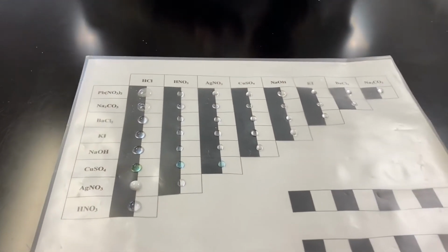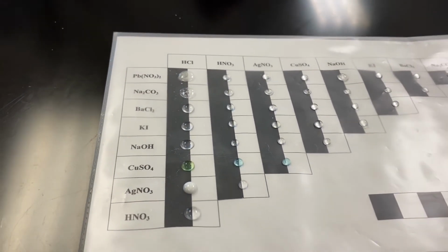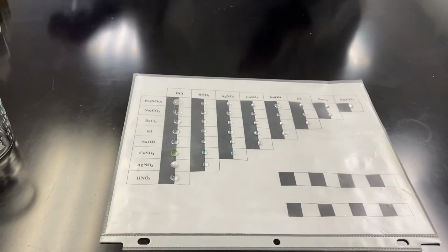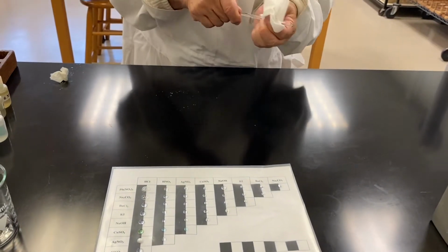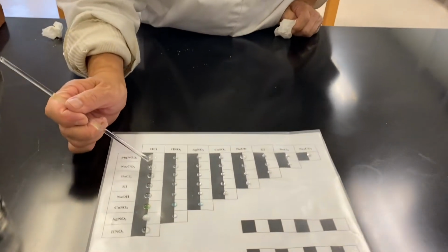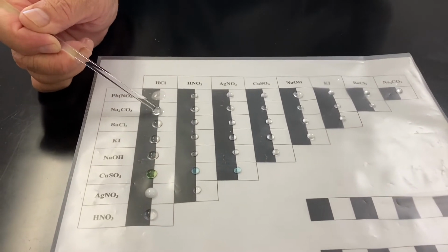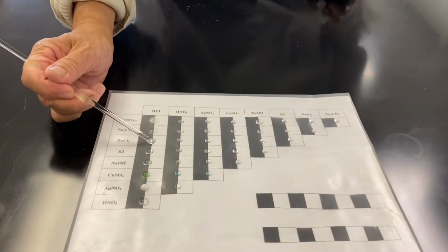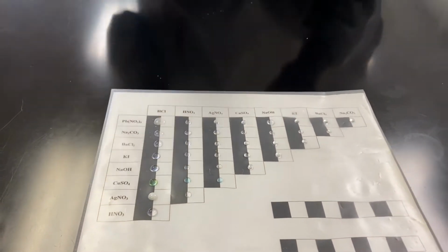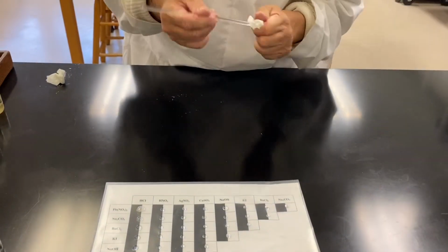Now you can see immediately the air bubbles still coming up, right? Very good. So now, remember, before you do any stir, you must clean your tip. 3 times the same thing, no reaction. 3 times one direction, 3 times another, no reaction.